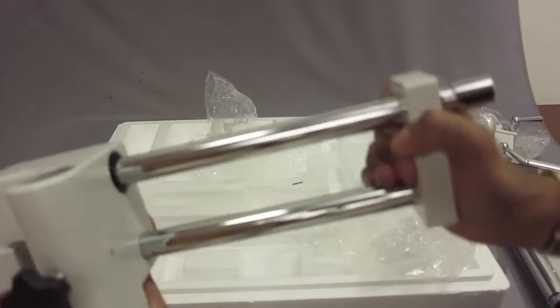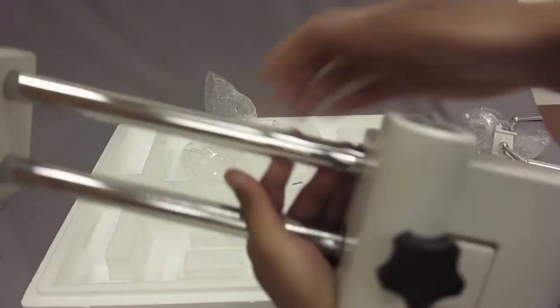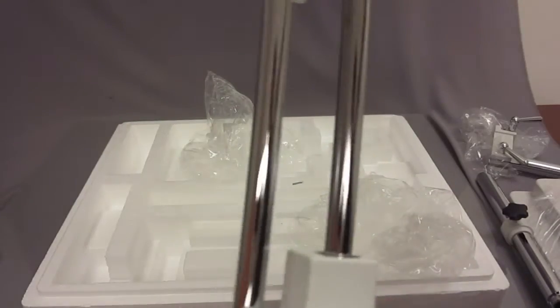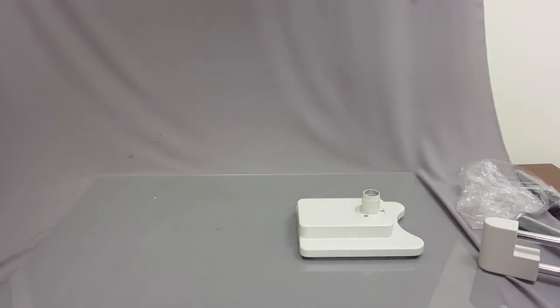This part is the double arm boom part, which allows you to slide your microscope and head easily. I'll show you how this all gets put together.